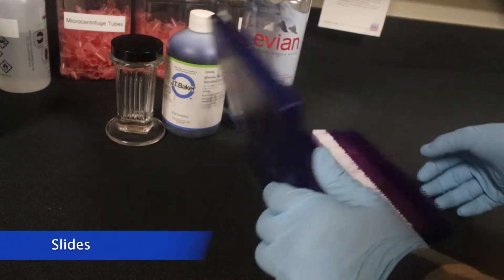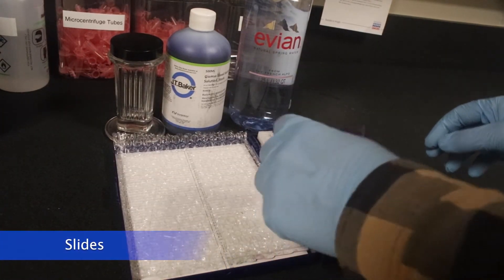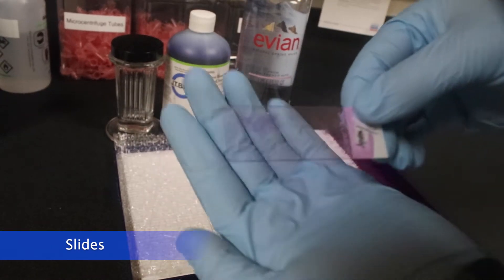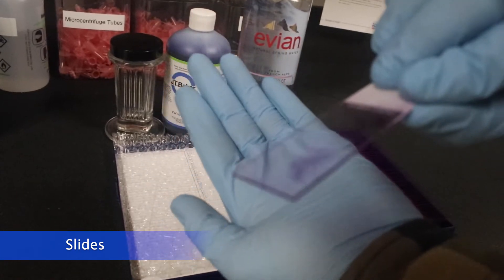And lastly, we have our box of slides, and these slides are already stained. In this video I'm going to be doing a re-staining, but they may be unstained and not already purple like you see here.